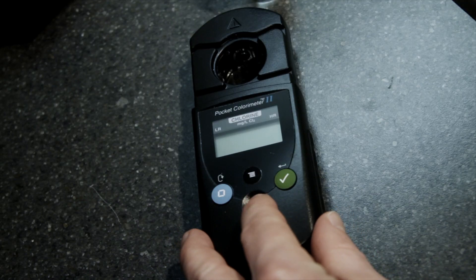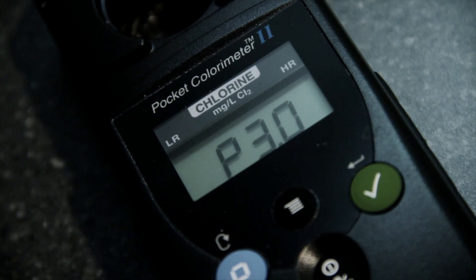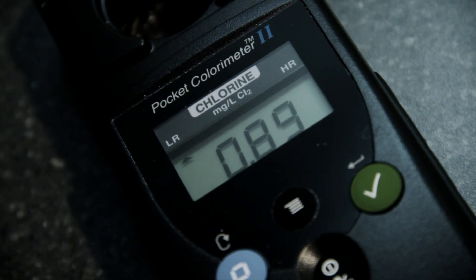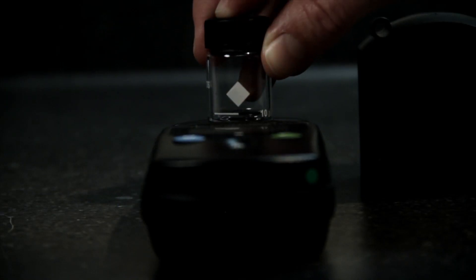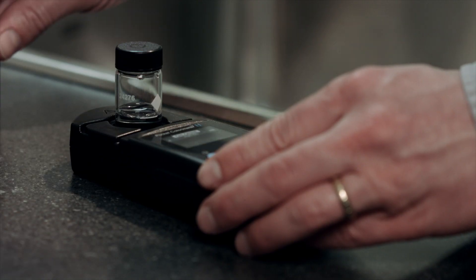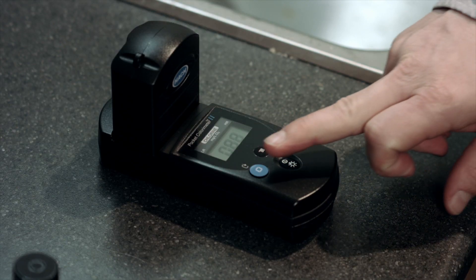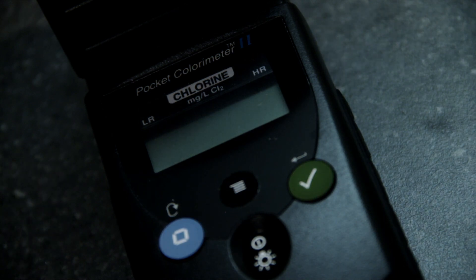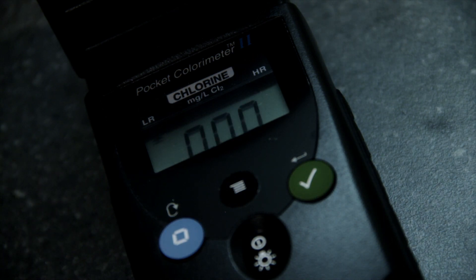Press the power key on your meter. The display screen will illuminate and an arrow should indicate you are in the low range. Insert the sample bottle into the meter with the diamond on the sample bottle facing the keypad. Cover the meter with the instrument cap. Press the zero key. The display screen will show 0.00. This ensures the meter has been properly zeroed for your test.